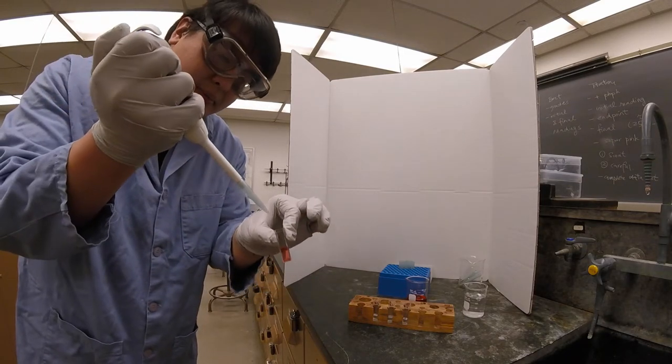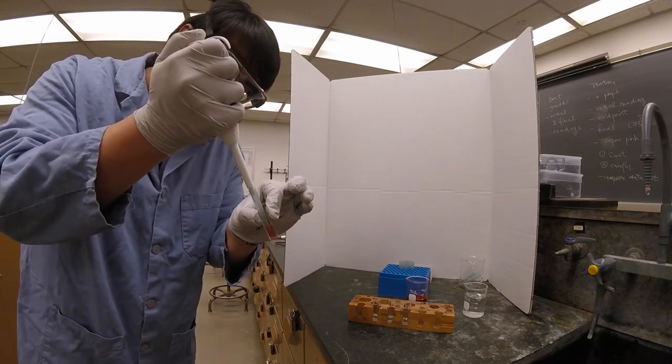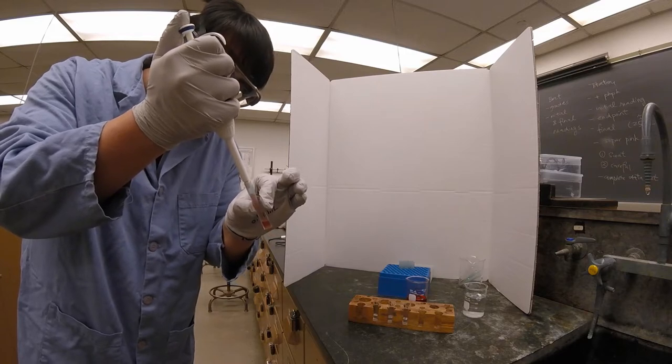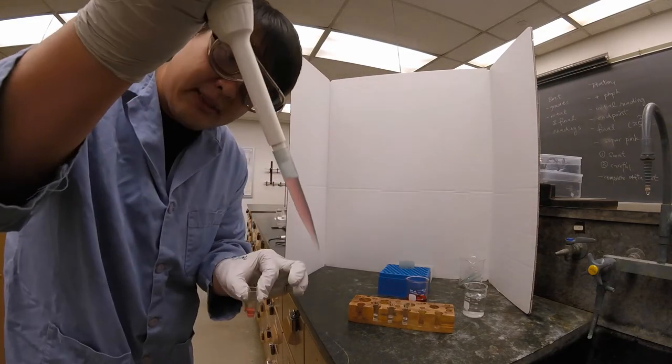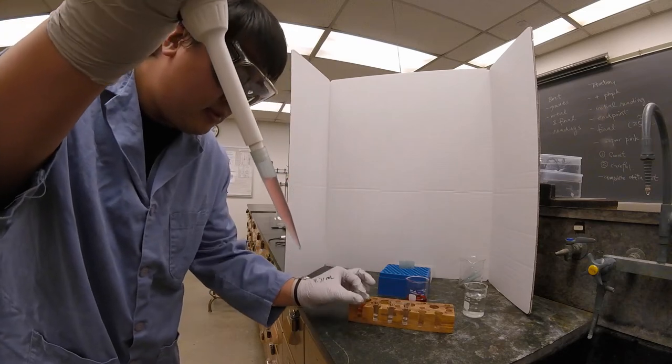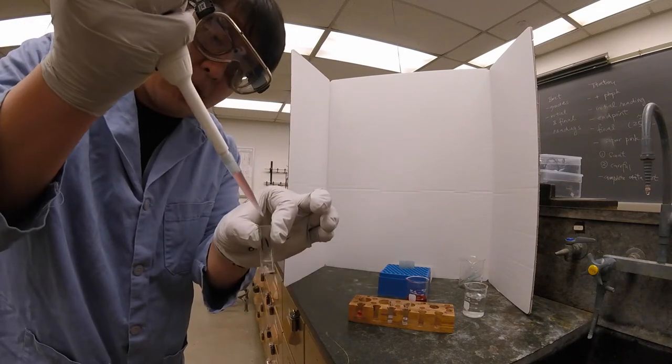From R1. So what you want is something with no air bubbles like this and then you want to put it into R2.